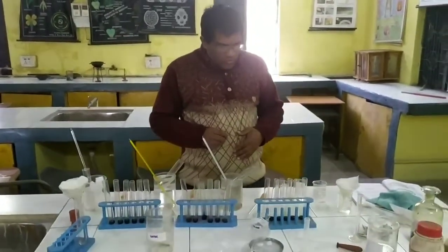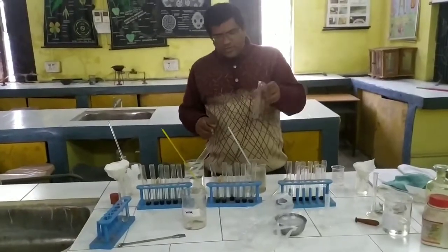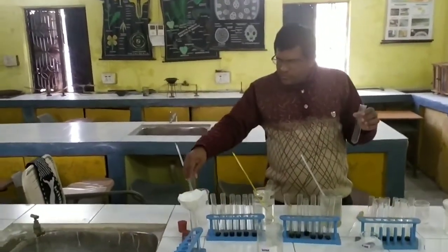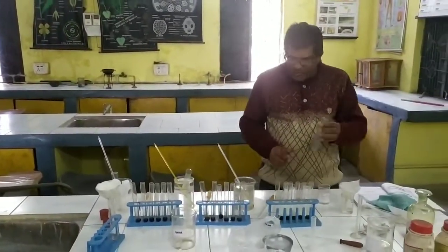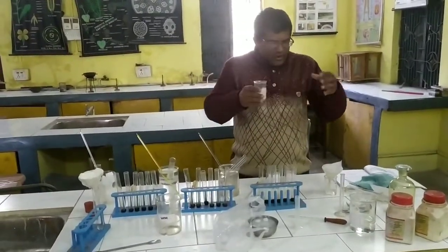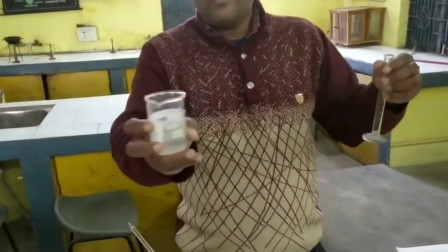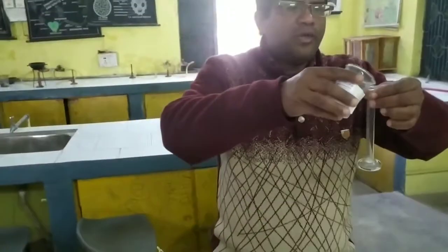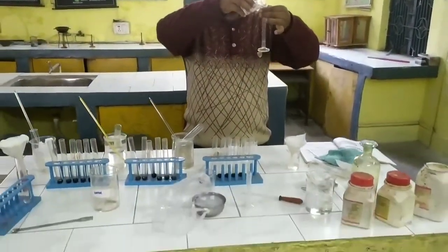Now children, what to do? You have to take 3 boiling test tubes: boiling test tube 1, boiling test tube 2, and a third. First, in this test tube we take the starch solution, the 1% starch solution already prepared. We have to take 5 ml of starch solution.